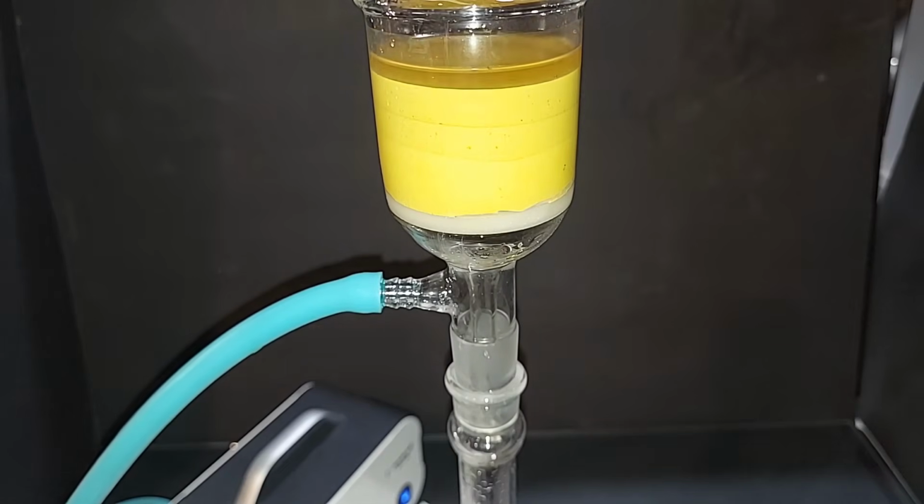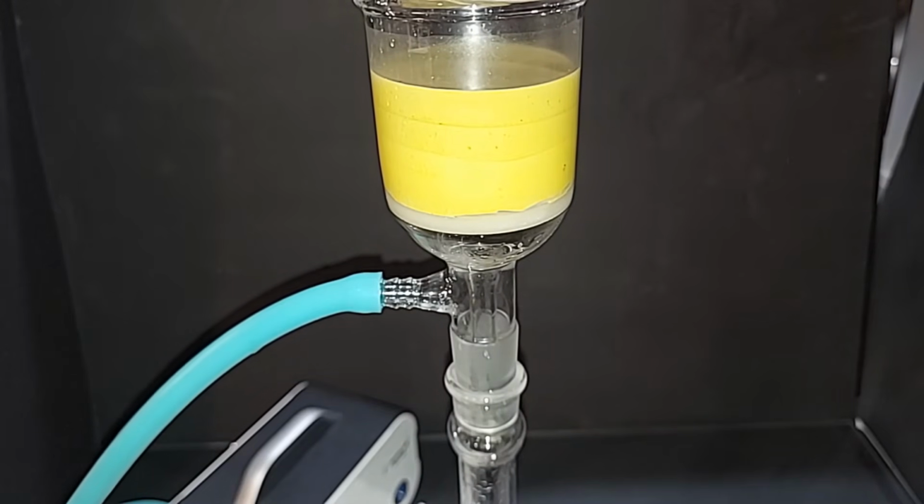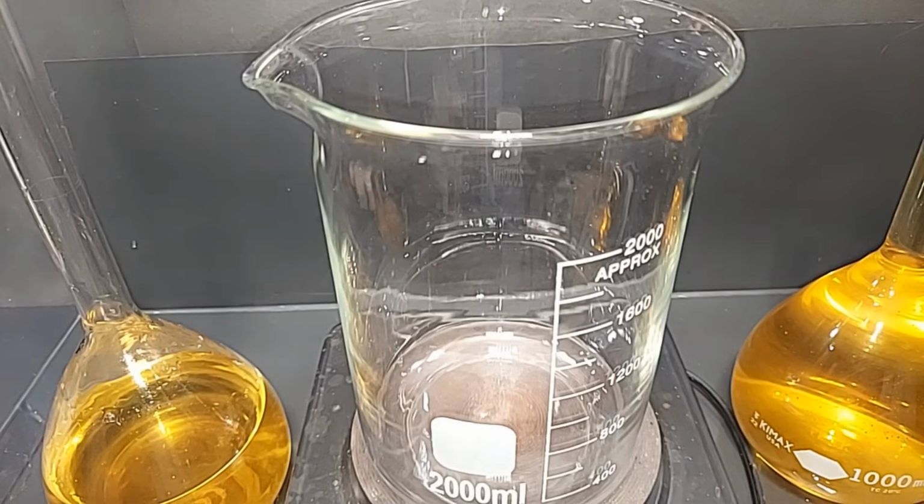It's about half of what I need to do. I'm going to turn this off because that needs to be obviously emptied, and then I'll continue on, but I'm going to do all that off camera. So the next step, we should have only the liquid sulfuric acid, plus of course there's other things in there, but we'll boil that down. Completely done removing all of the iron oxalate.